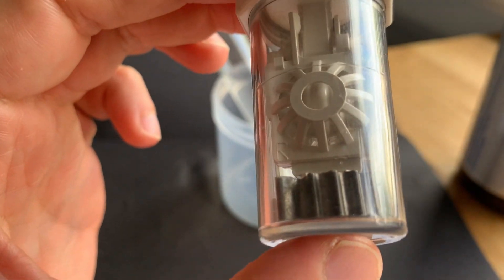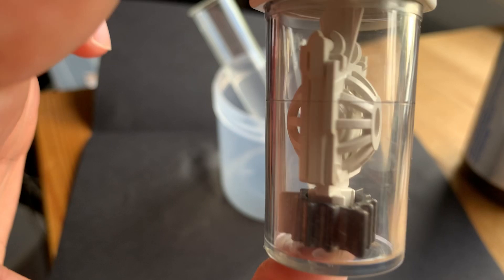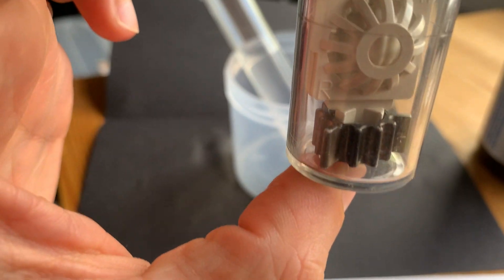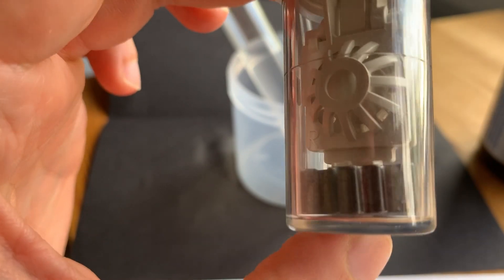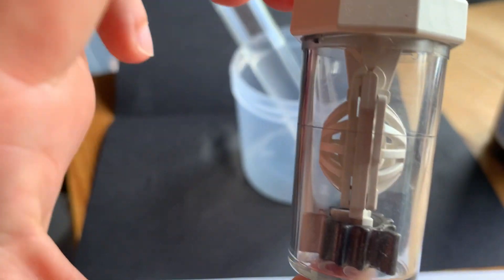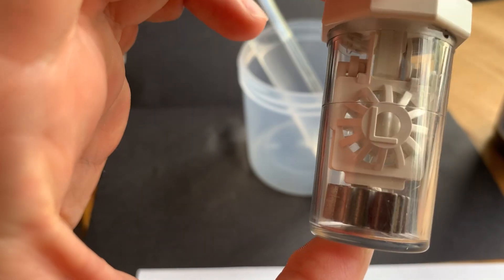They put their contacts in here. The hydrogen peroxide ends up breaking apart on this little metal piece at the bottom. That gas bubbles out, and apparently that helps to clean the contact lenses themselves. Let's pour a little hydrogen peroxide into here and see if we can get it reacting.